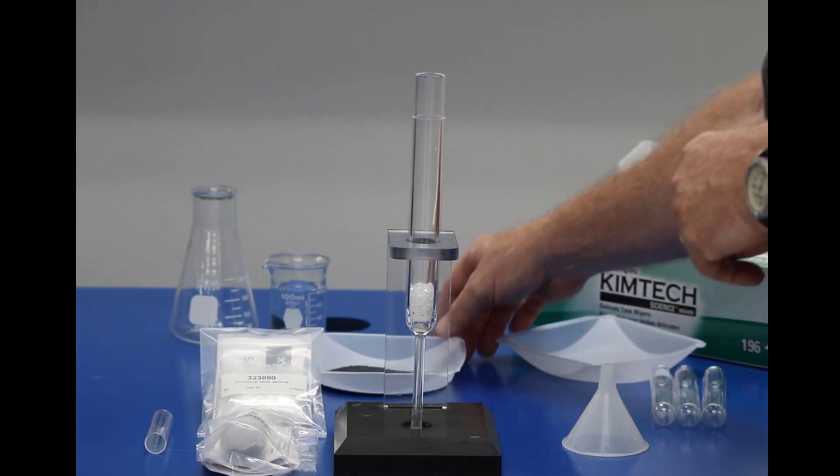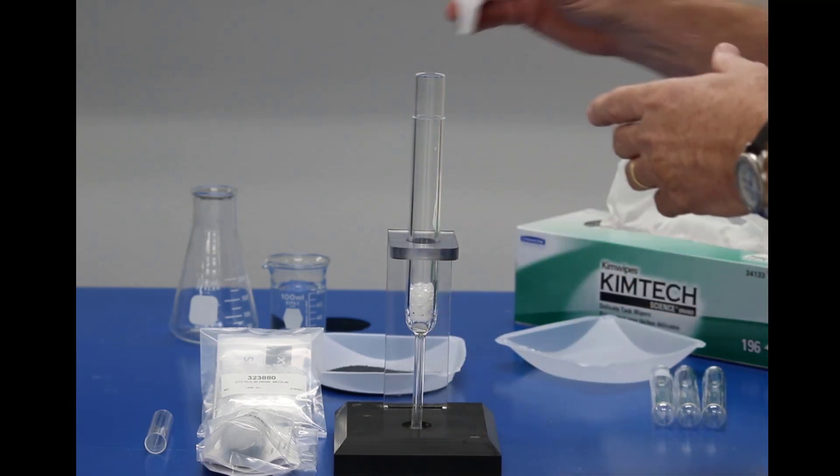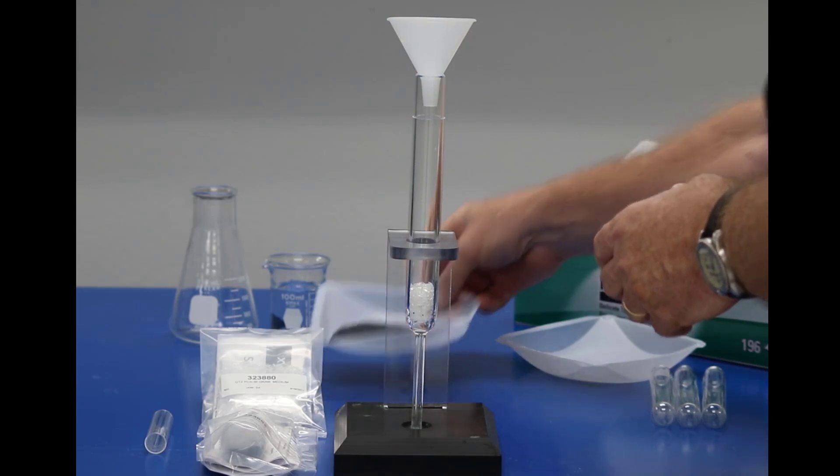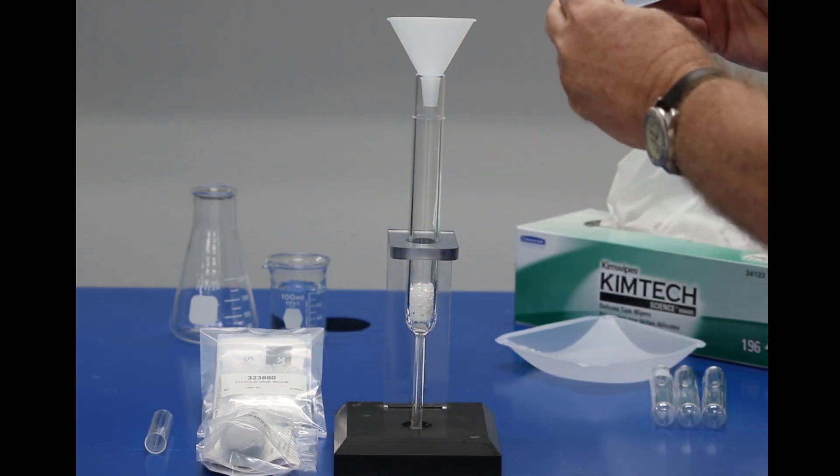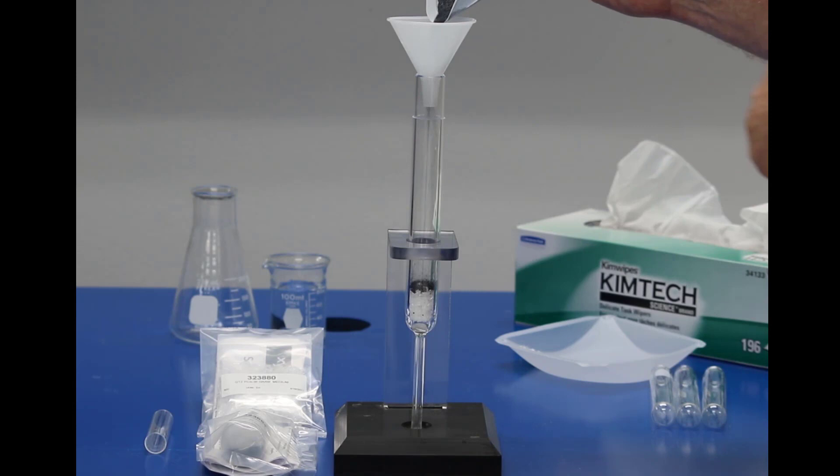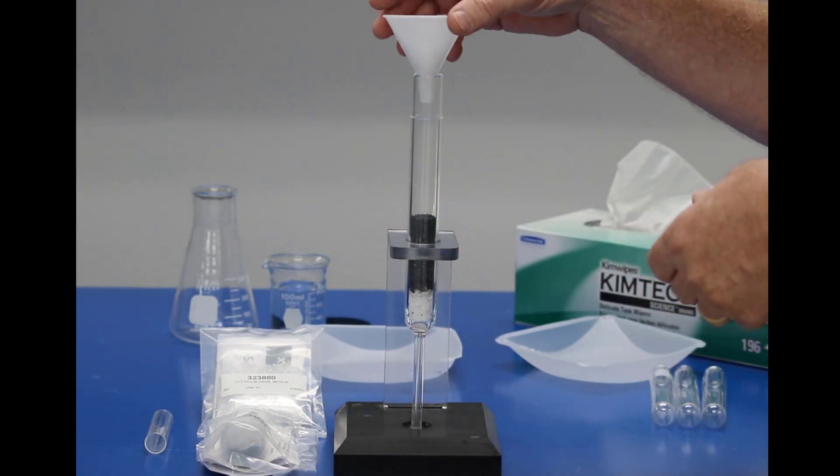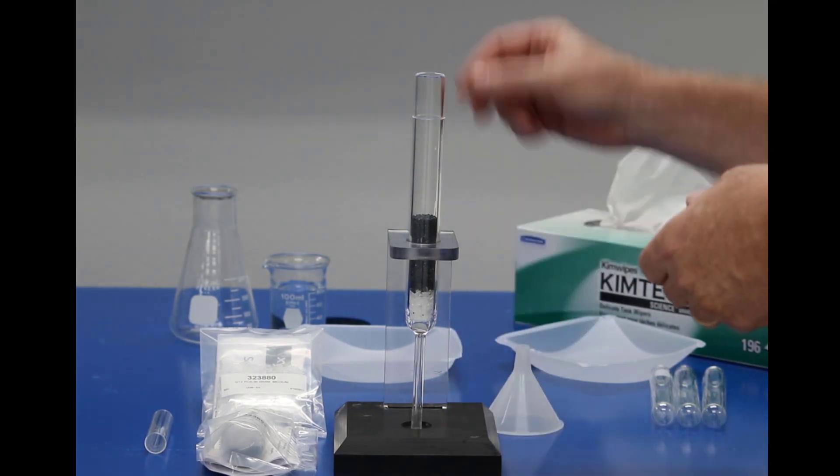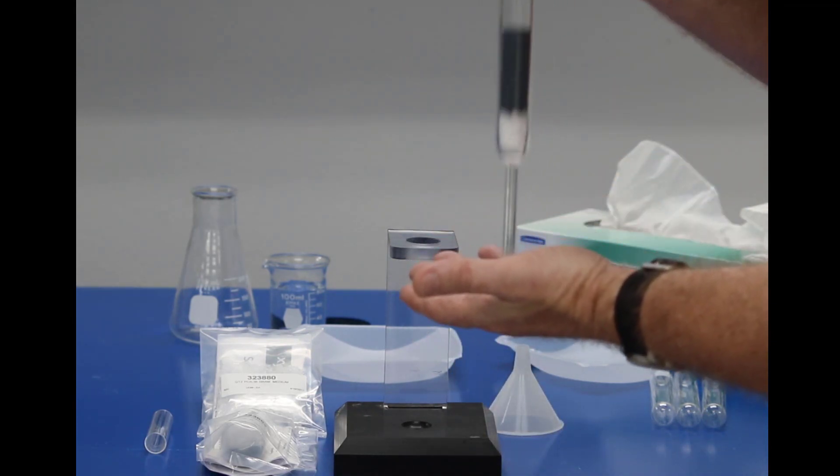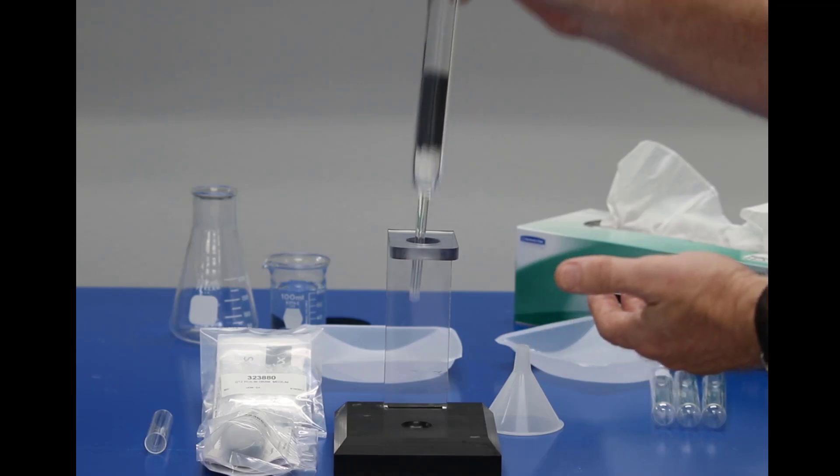Next, I'm going to take the entire contents, all 15 grams of catalyst, and pour that in. Take this out. Occasionally, I'm just going to tap it down a bit.